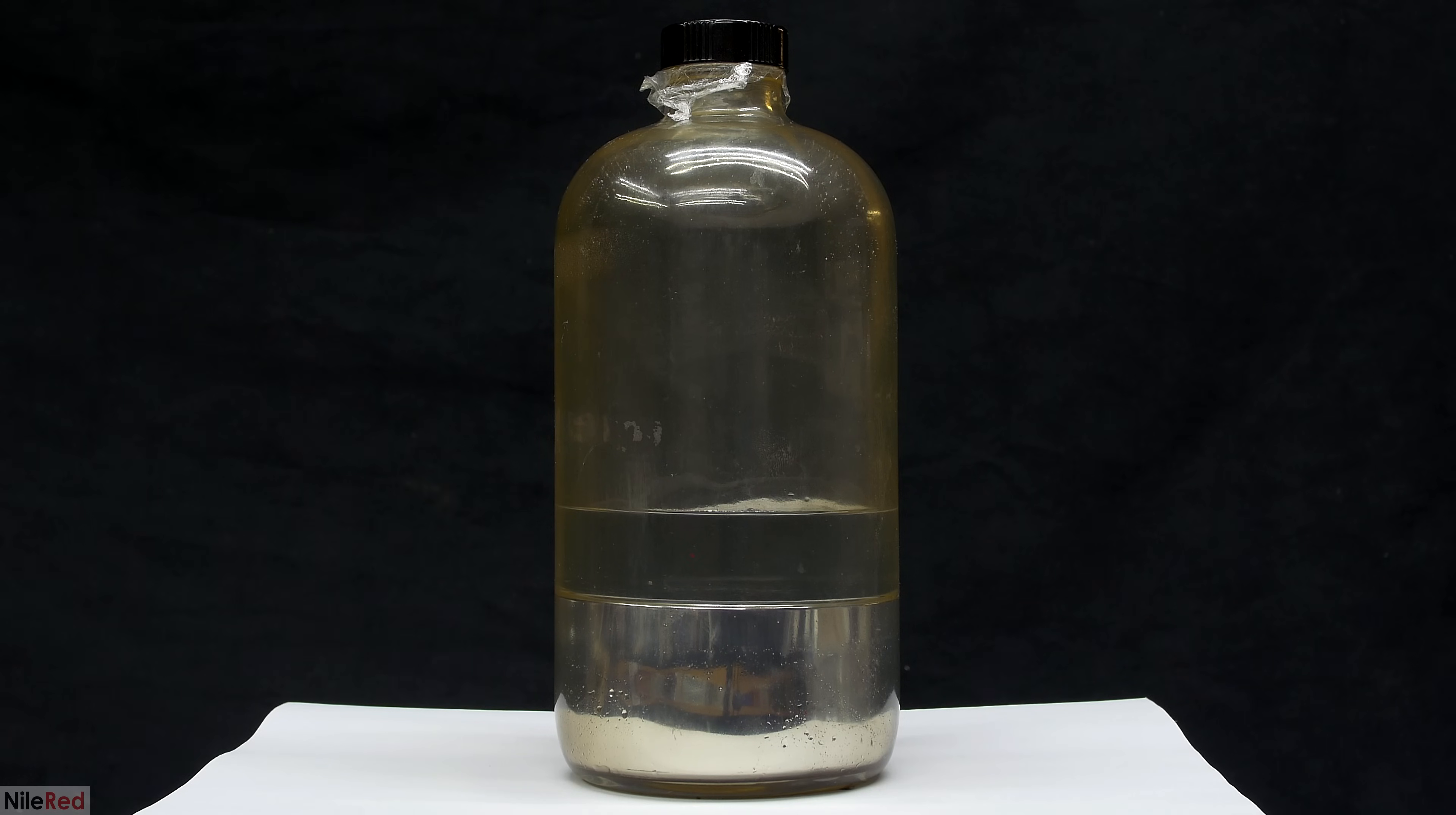Anyway, for these two reasons and the added fact that mercury looks much cooler without water on top, I decided to get rid of the water. Also this bottle wasn't exactly the most secure, and even though it was shatterproof, it still wasn't ideal.